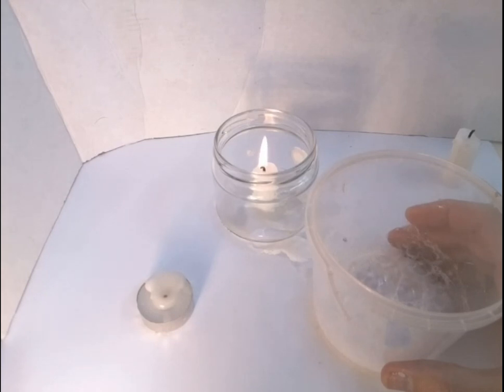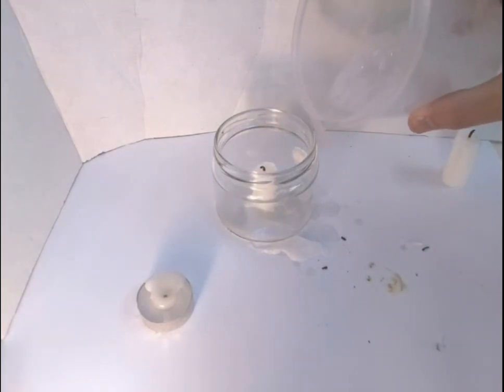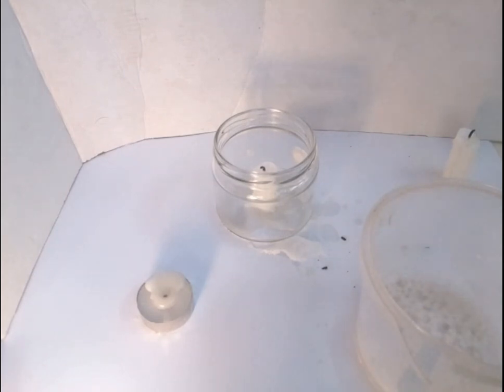So I'm leaving it so that hopefully the CO2, which is heavier than air, heavier than most of the components of air I should say, will settle. Oh, and I pour it in, and look, there we go. So as soon as I pour the CO2, you saw that you didn't see anything come out of the large pot, but I poured CO2 out and it extinguished the flame.